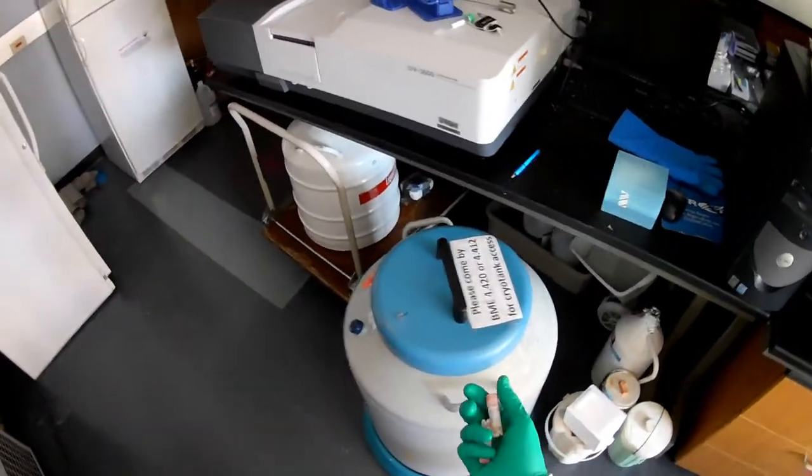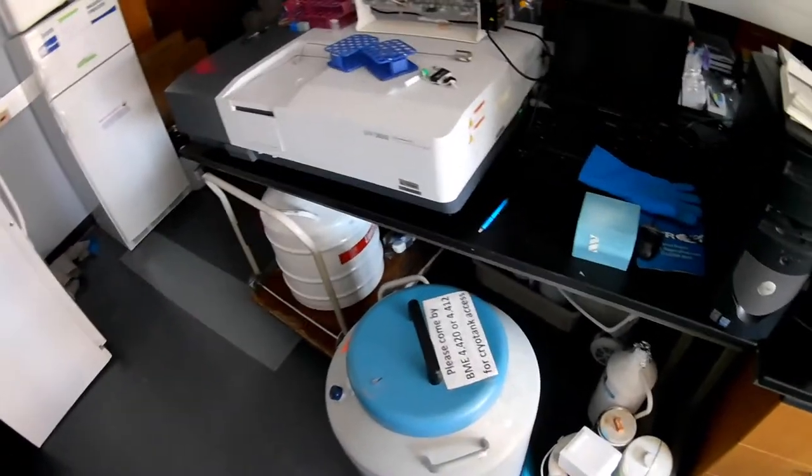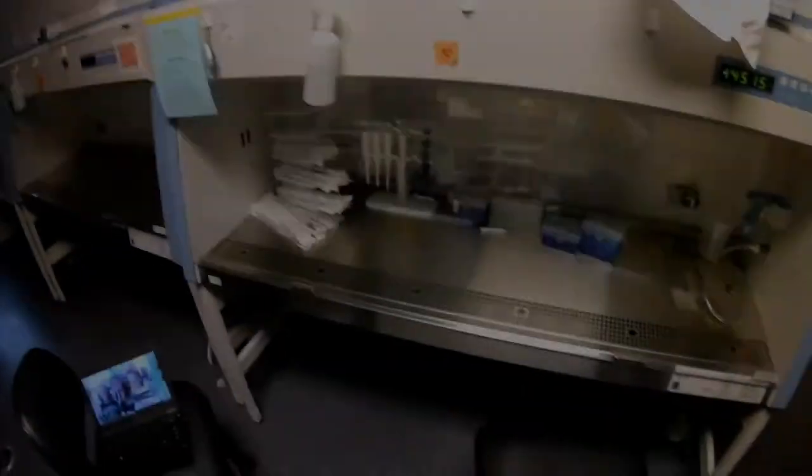I'm going to go ahead and throw these in our minus 80 degree freezer. It's very similar to this downstairs. While I get everything else ready, but I just wanted to retrieve it from liquid nitrogen first. All right.